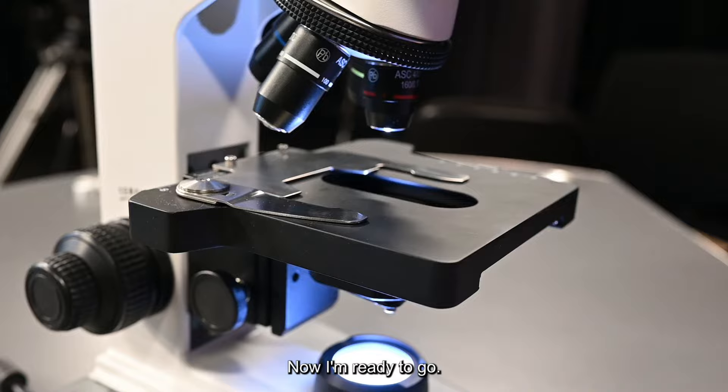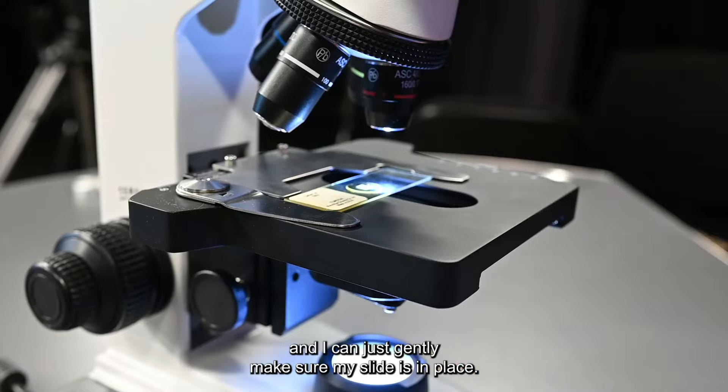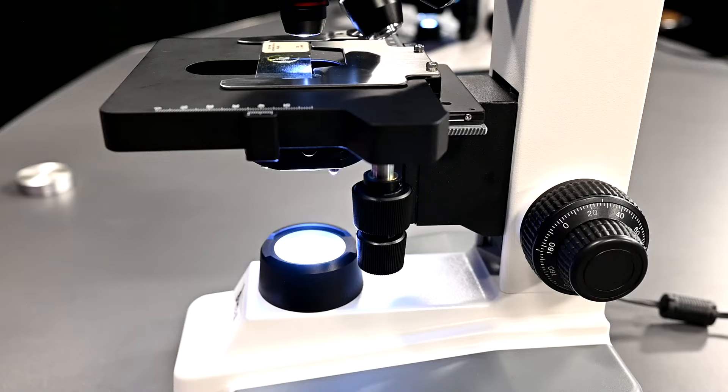That's why I clicked that one into place. Now I'm ready to go. I can take my slide and then I can move this little stage clip and I can just gently make sure my slide is in place.